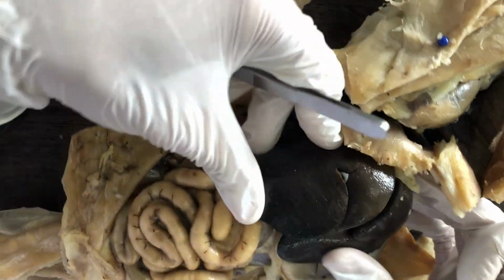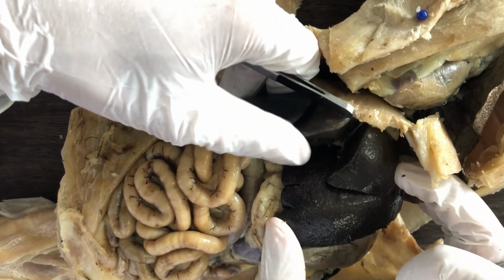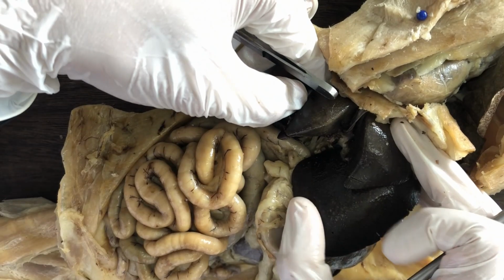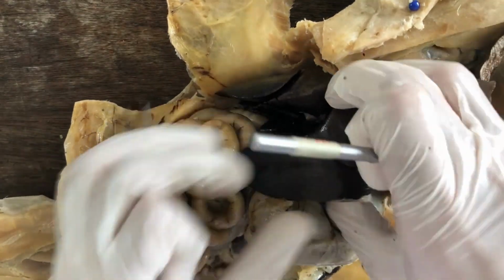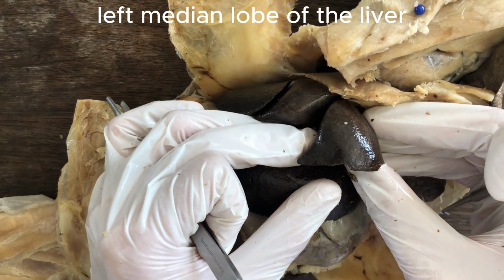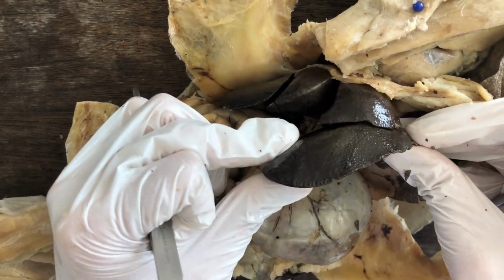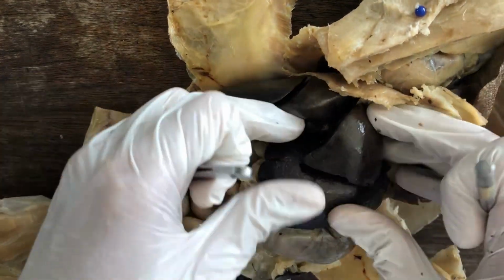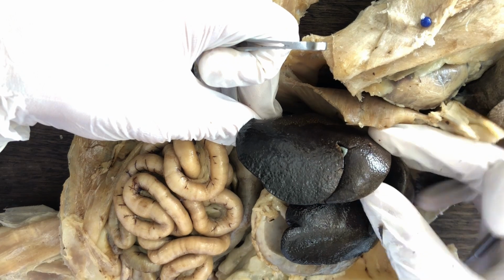And so the liver is divided into several lobes. Just like the lungs, it's divided into left and right lobes. And then each one of those lobes will be further subdivided into medial and lateral lobes. So for example, let's take the left lobe of the liver. Here's the median lobe, or median left lobe of the liver. And the larger one is the lateral left lobe of the liver, or left lateral lobe. Choose whatever syntax you prefer. And then the right lobe will also be divided into median and lateral lobes.